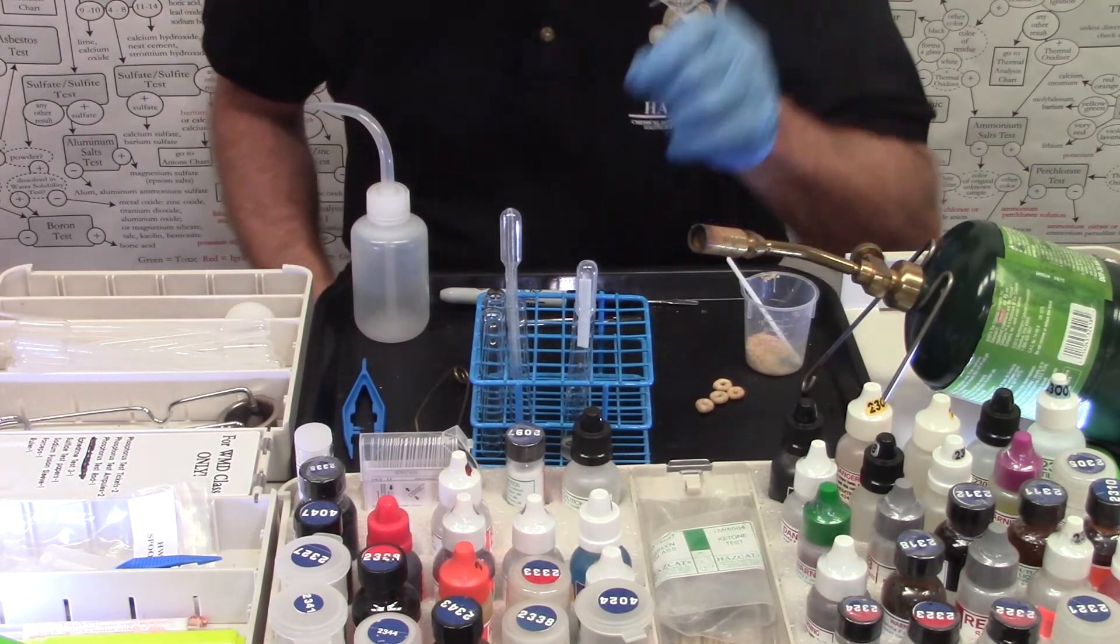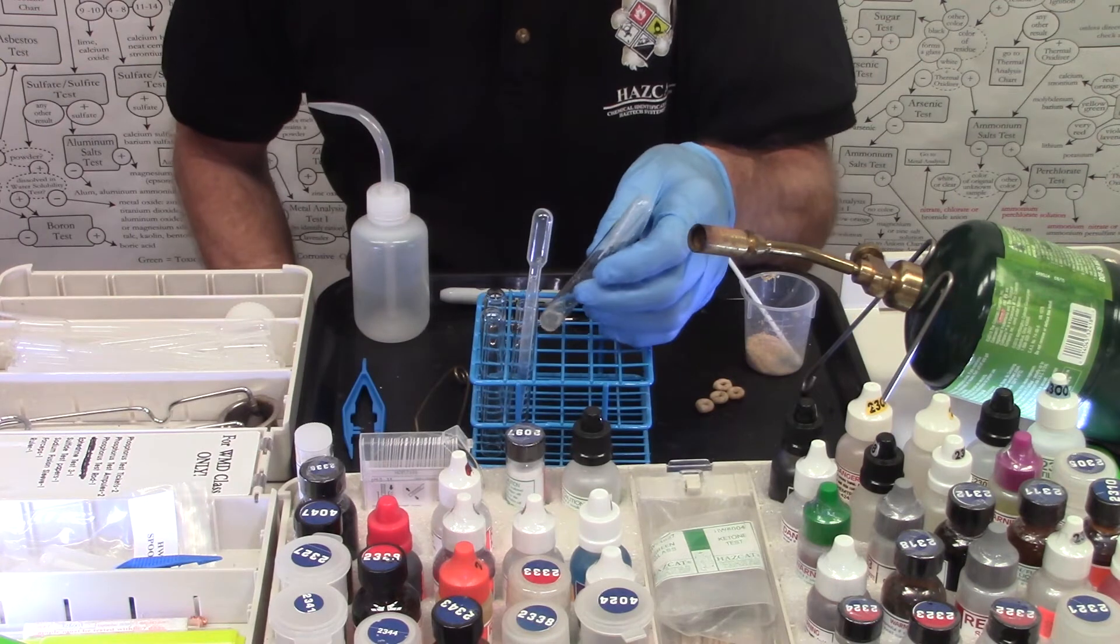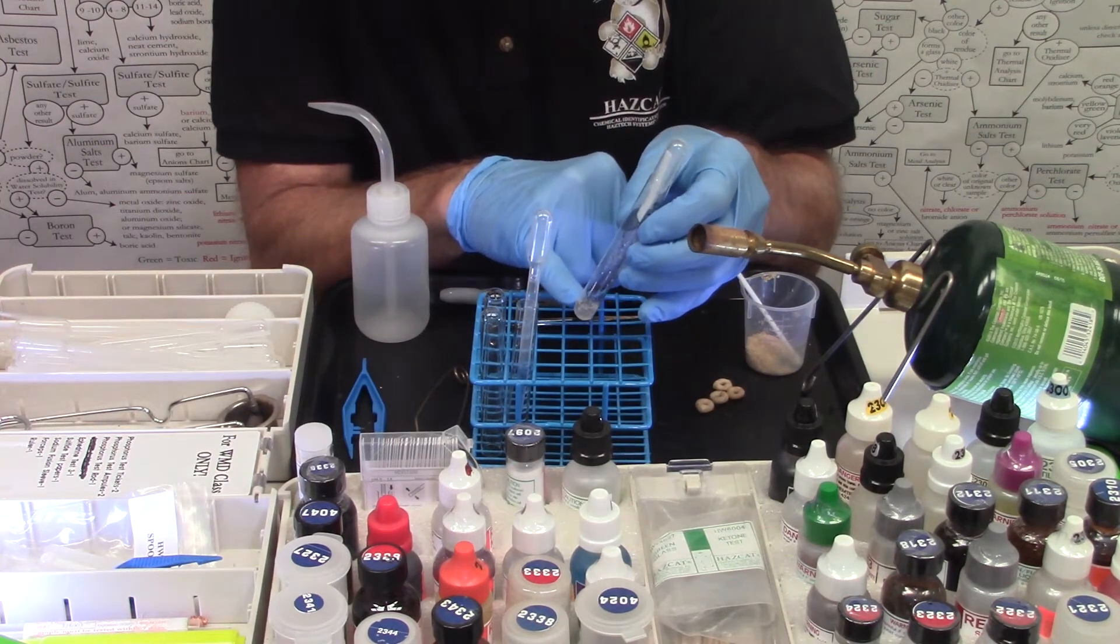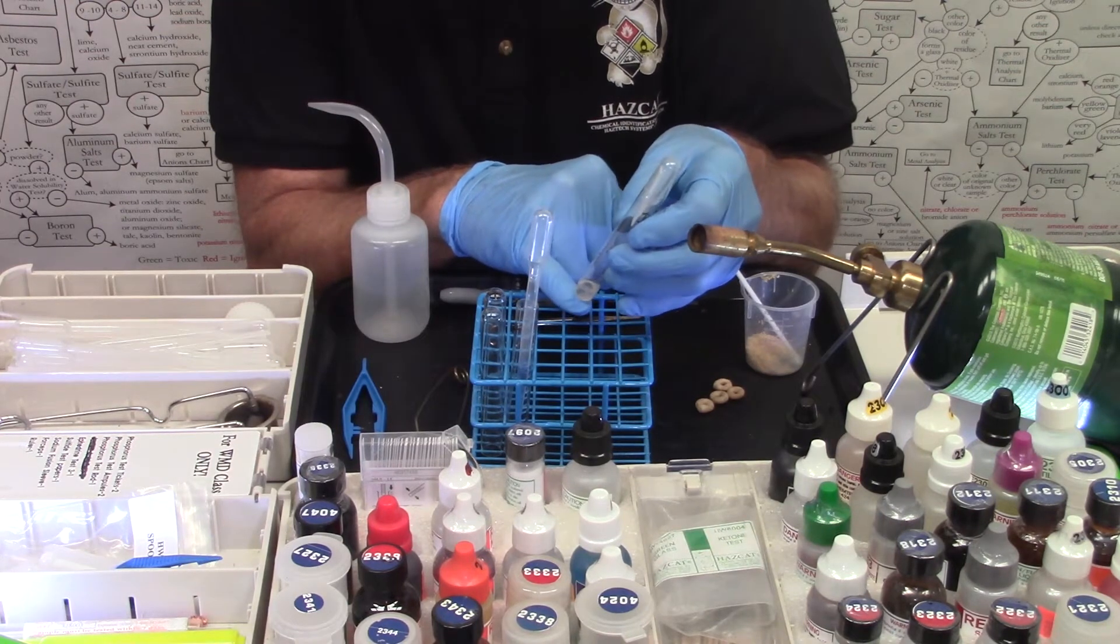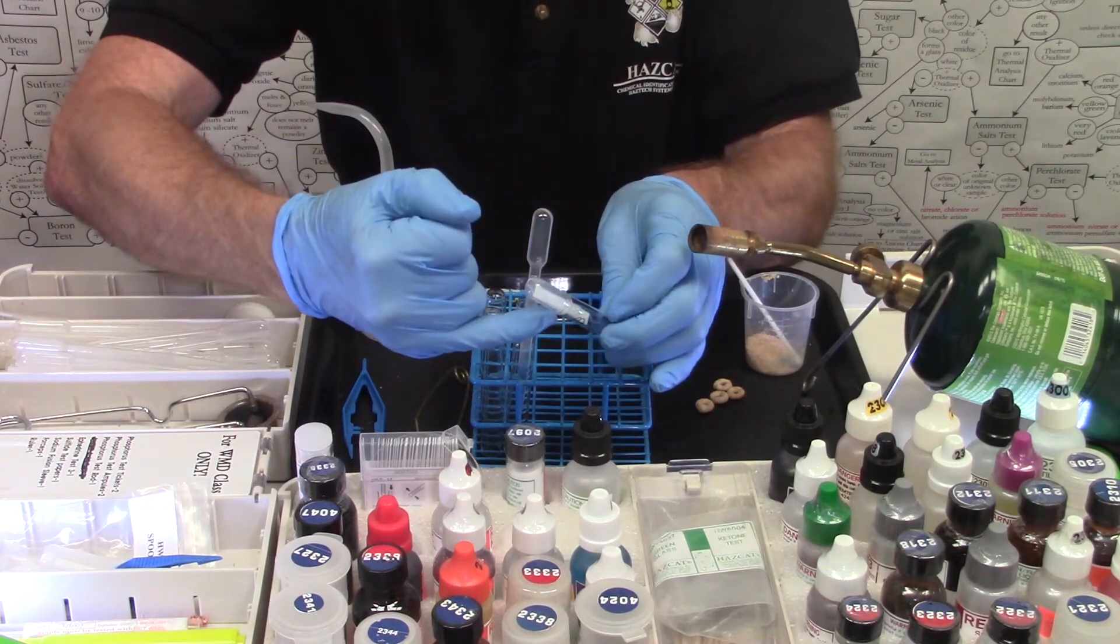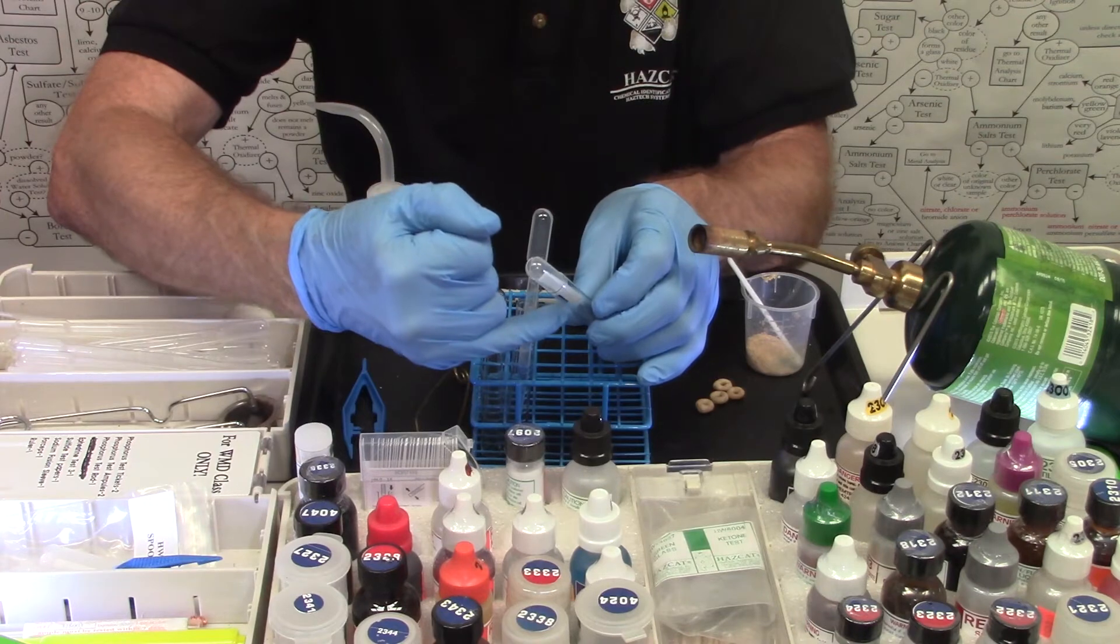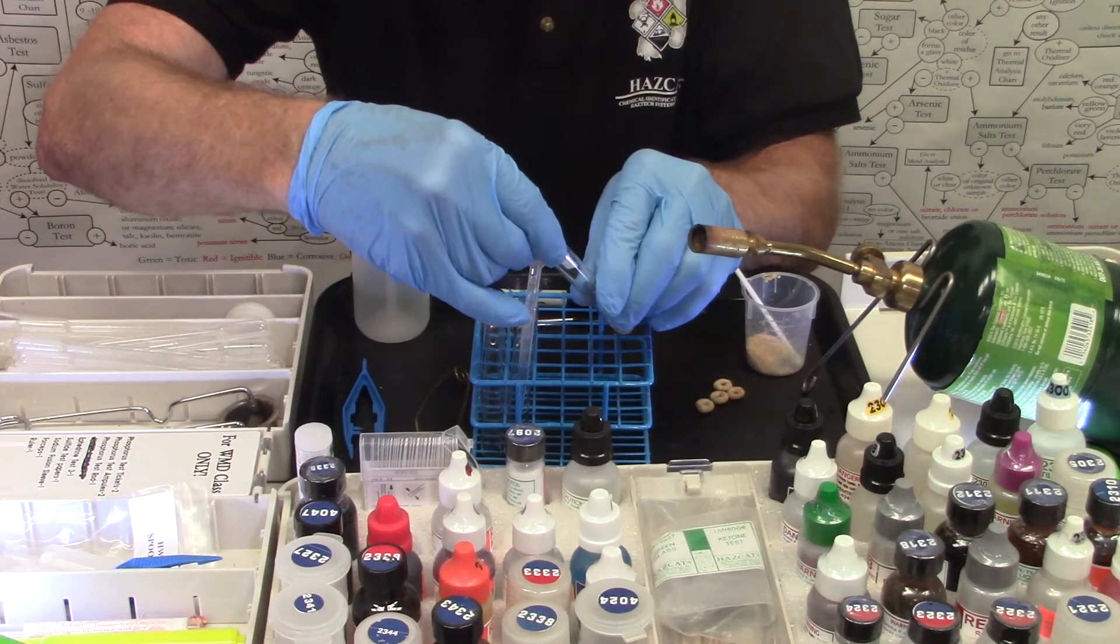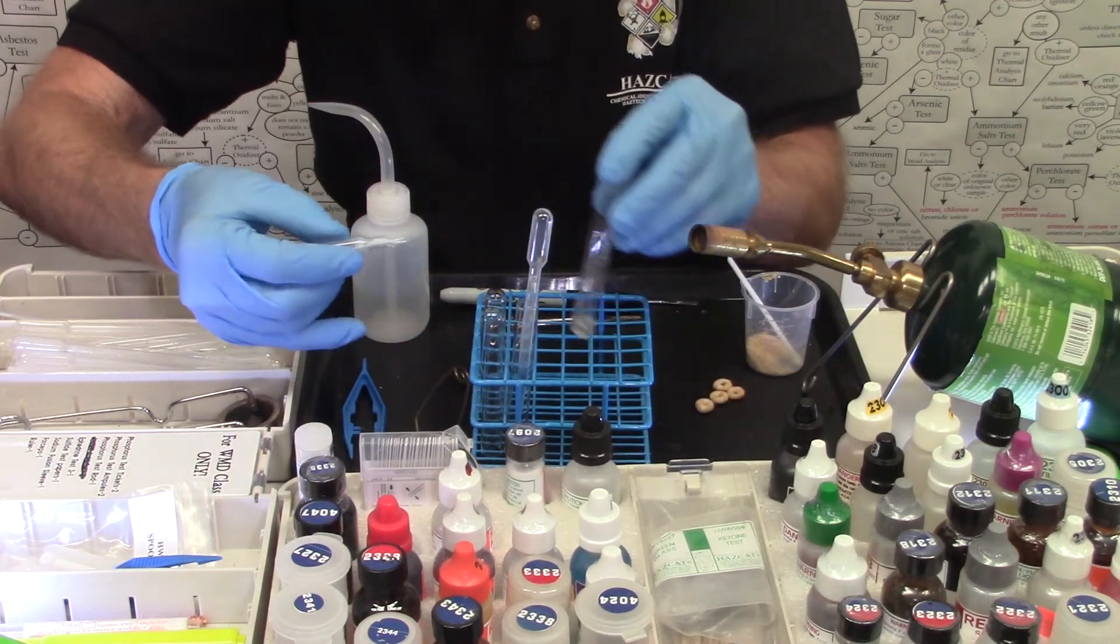Okay, our five minutes are up. We're going to take and remove the bulb after we examine the test tube. We're looking for the formation of a white solid down here. That might indicate an amine or a thiocyanate. And we're looking for any coloration on the paper. It stayed white, but if it turned orange to brown, there might be sulfides present as well. So it stayed white. The Cheerios down below didn't turn into a white solid. We're going to remove the bulb.